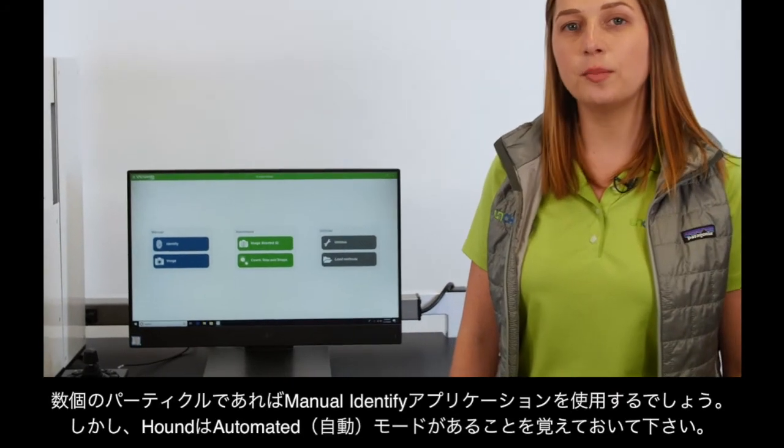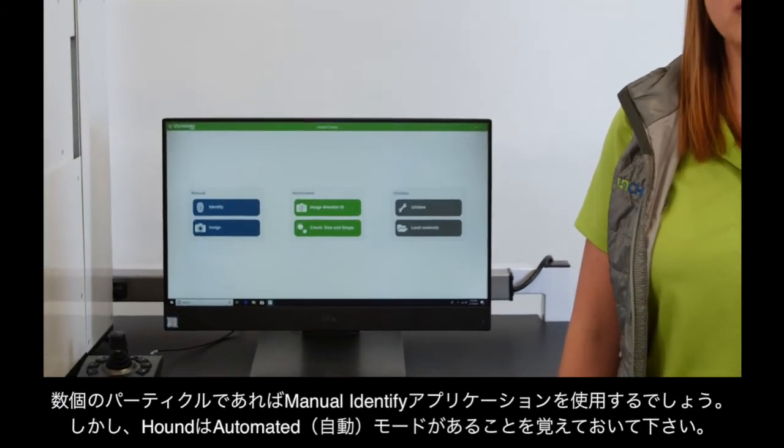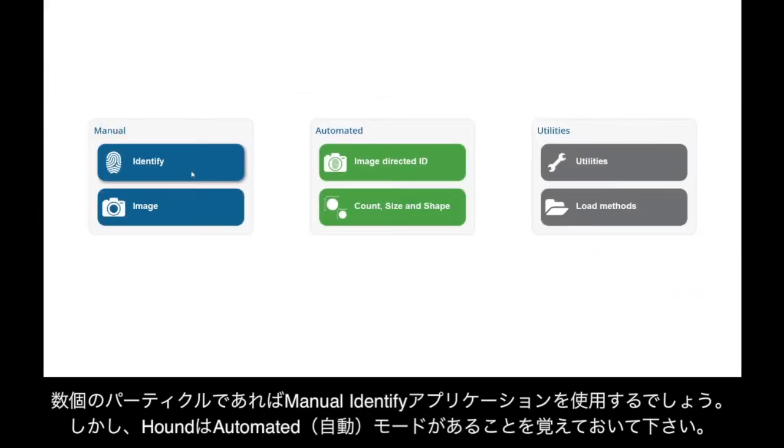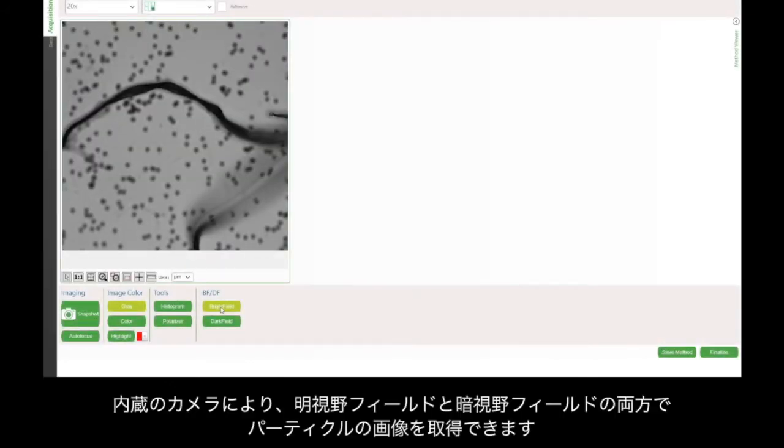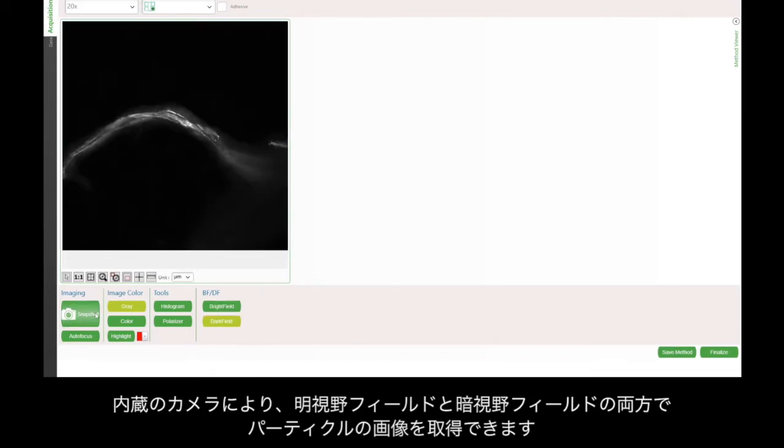Since I only have a few particles, I'm going to use the manual identify application, but keep in mind that Hound has an automated mode, so you can analyze hundreds or even thousands of particles at a time. With the built-in camera, I'm going to take a few images of the particle in both bright field and dark field mode.